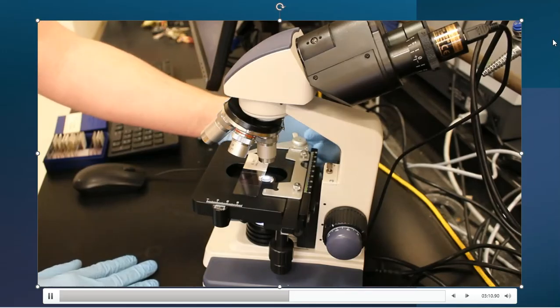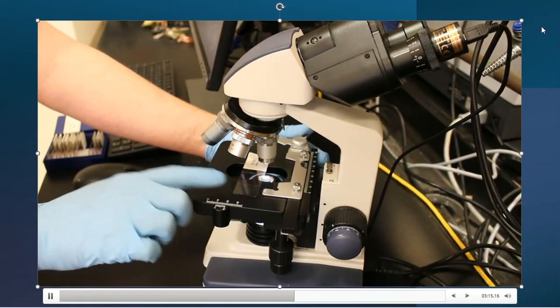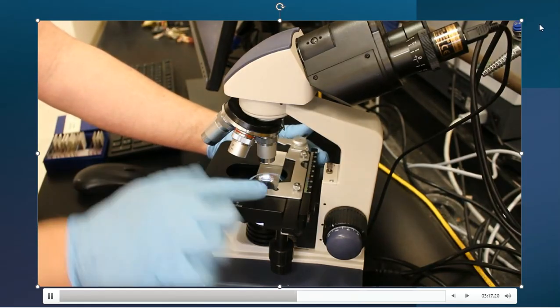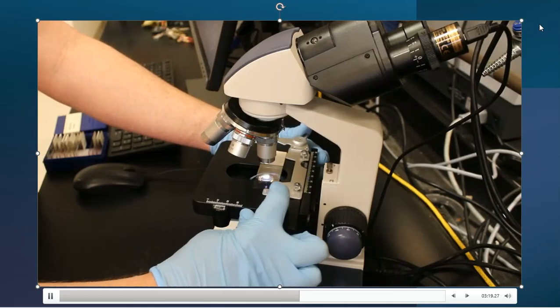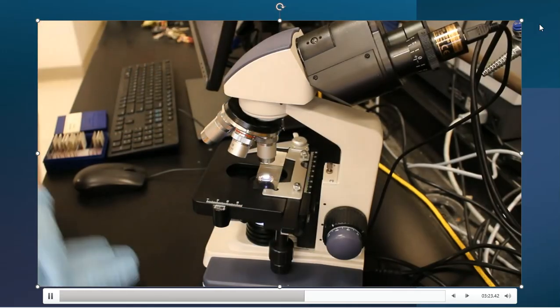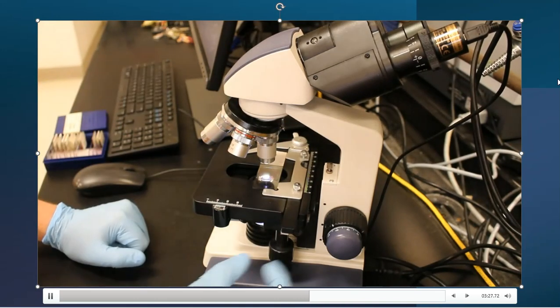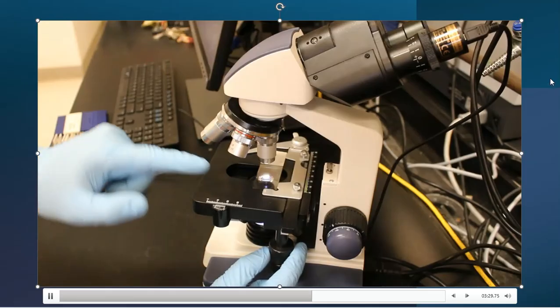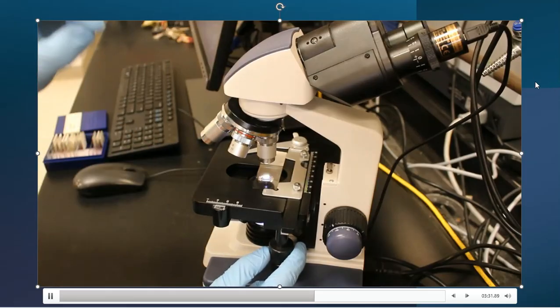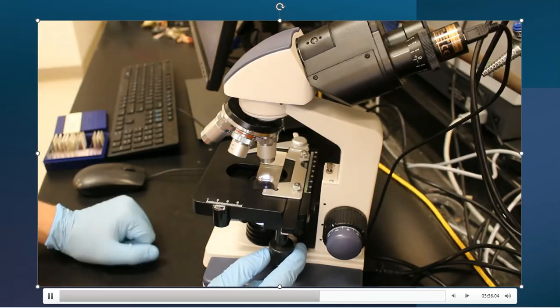There's a clip, you probably can't see it in the video, on the back side here, that I'm going to push my thumb against, and that microscope slide will fit on the edge, at a 90-degree angle right here, and that clip somewhat holds it into place. So when we load the slide on, we will make sure that the sample on the slide is underneath the microscope lens.